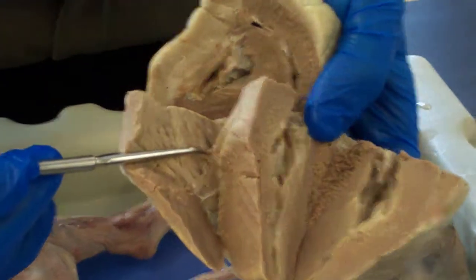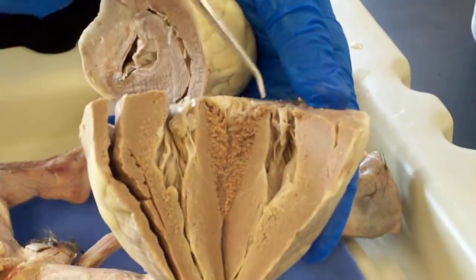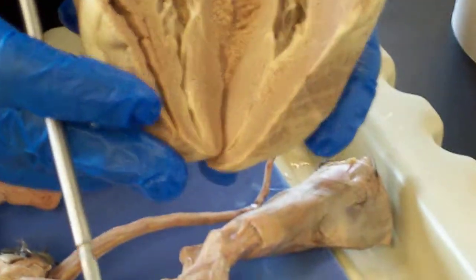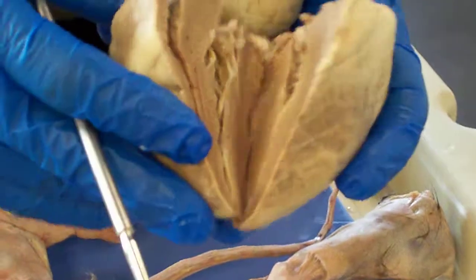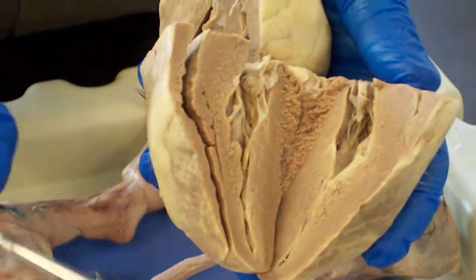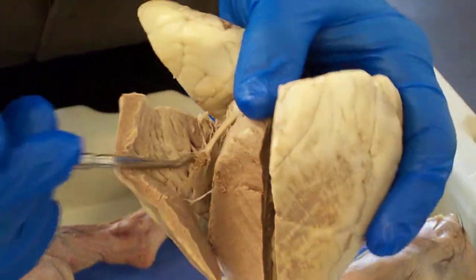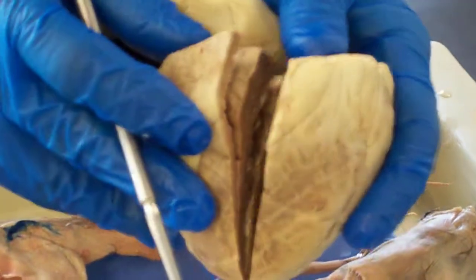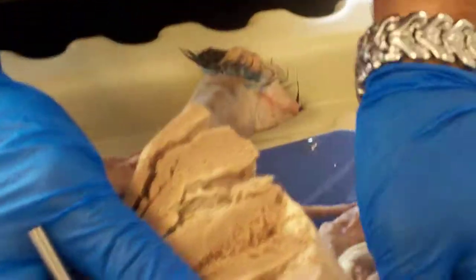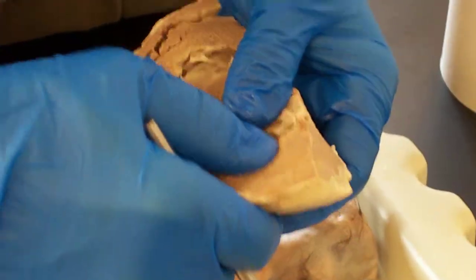In the right ventricle there's a tricuspid valve, and what leads to the left ventricle is the bicuspid valve. The only way to get out of these ventricles is through semilunar valves — there's a pulmonary semilunar valve that leaves the right ventricle and an aortic semilunar valve that leaves the left ventricle. Let me open the left ventricle to see if we can find that semilunar valve.